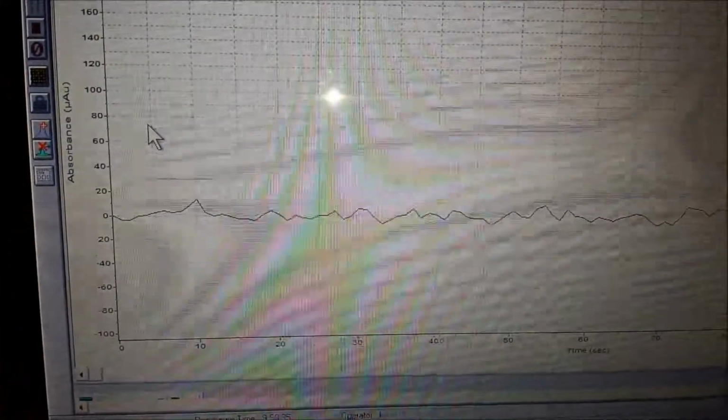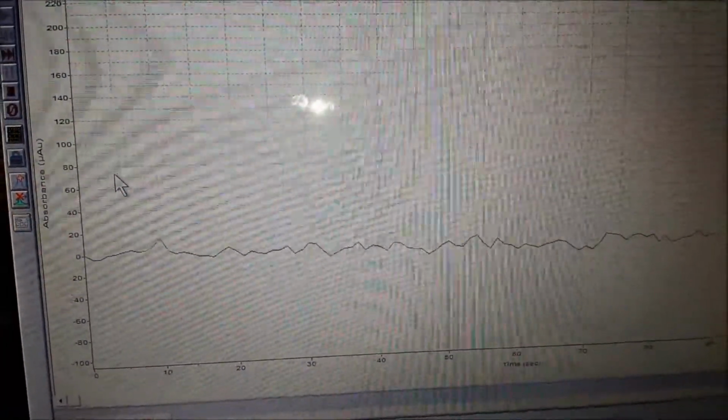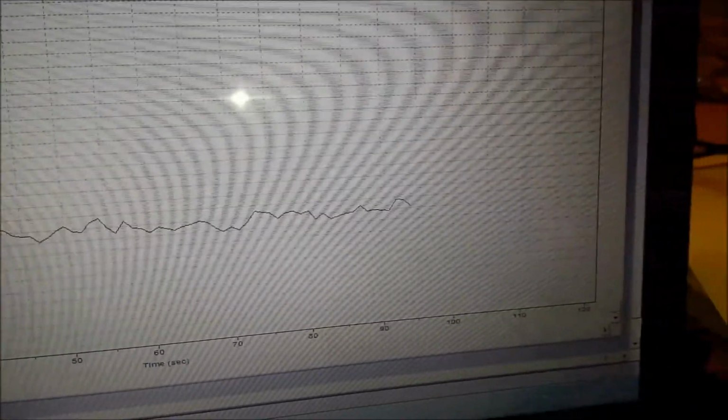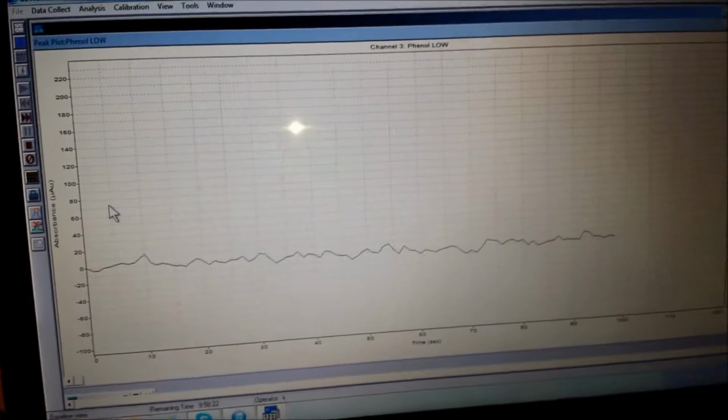The actual specifications are no more than 200 microabsorbance drift over 300 seconds. You can see clearly here that this is a very flat baseline and is going to be stable overall.